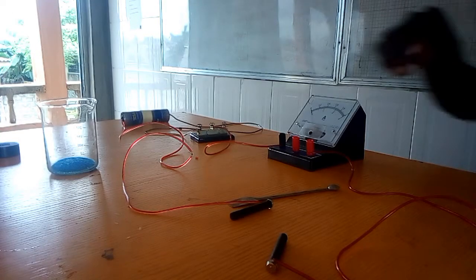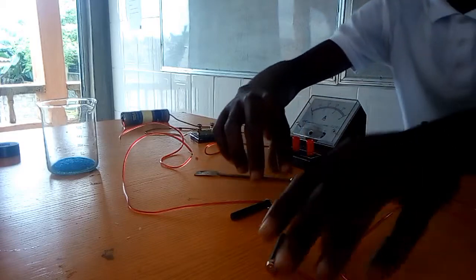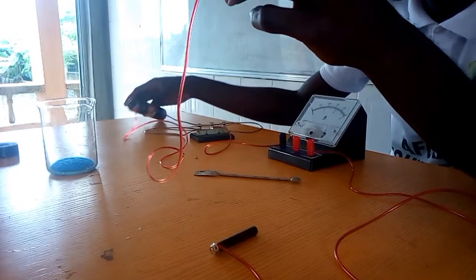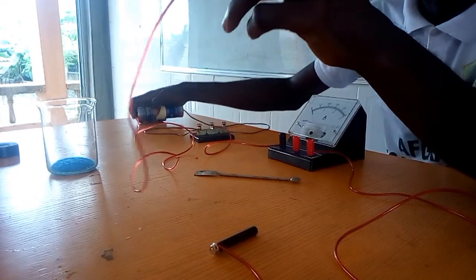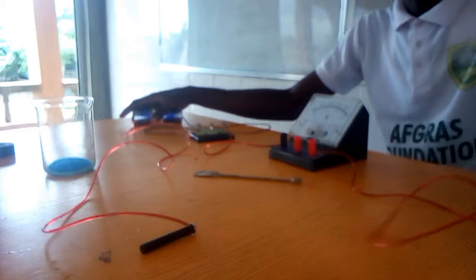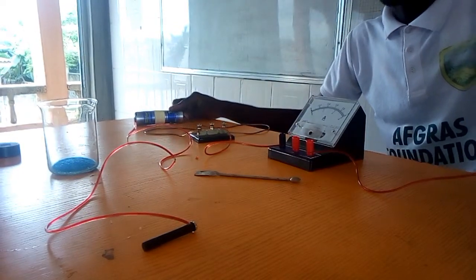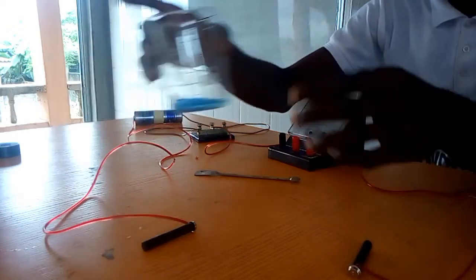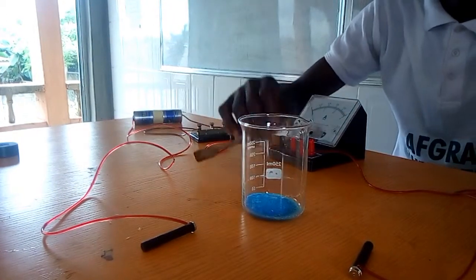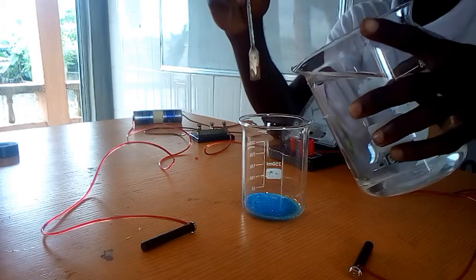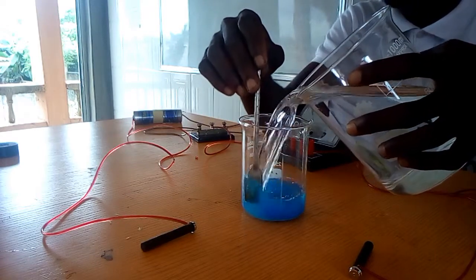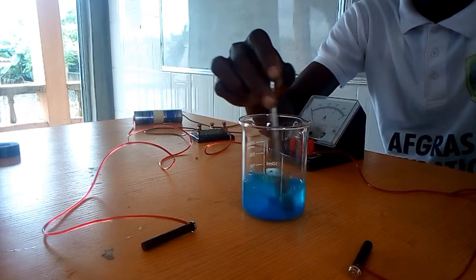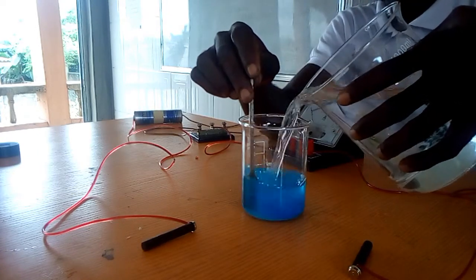Let's see how the practical goes. We have the two rods here, of which one is connected to the positive terminal of the battery and that is regarded as the anode, and the other one is connected to the negative part of the battery and that happens to be the cathode. And this is our salt. Let us dissolve this in water because we know that we have to make it an electrolyte and it has to be in molten or solution form. So now we have to make the solution of this. As you can see, its color is blue.